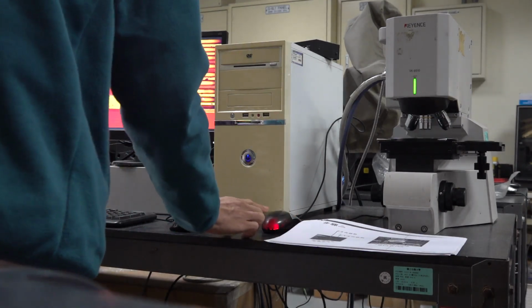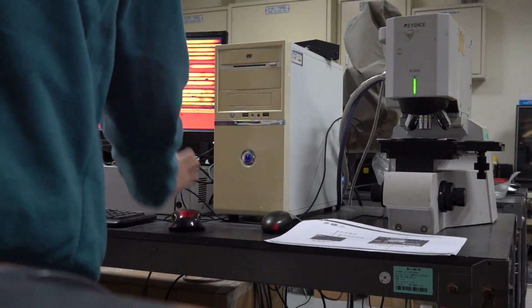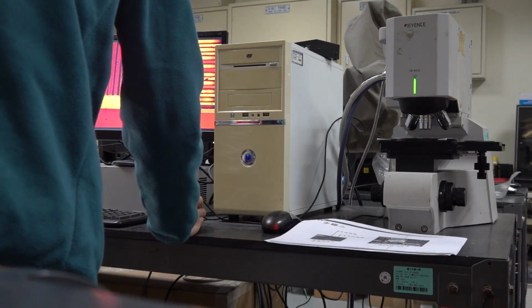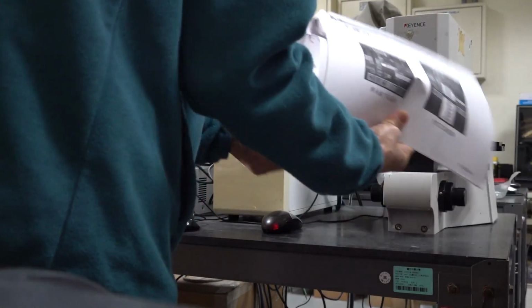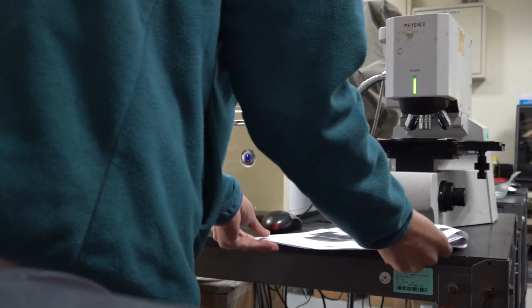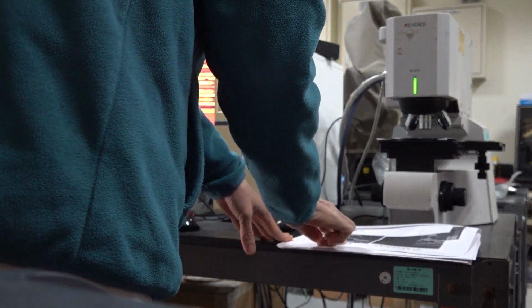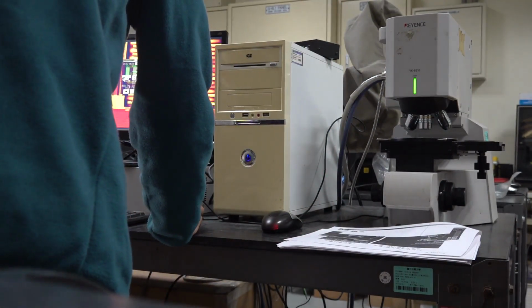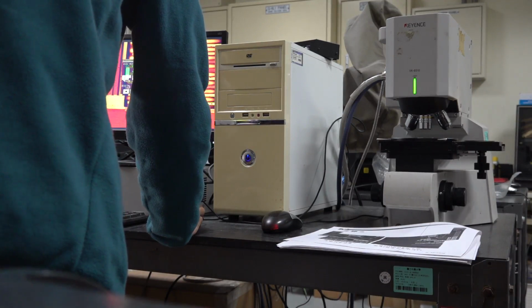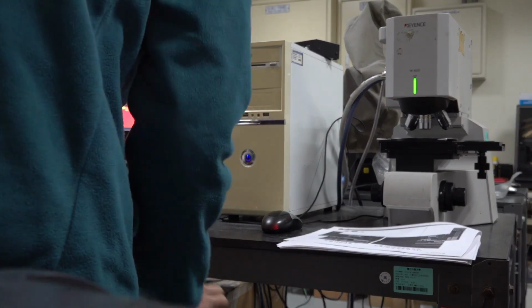So we have 2 mice, one mouse for the PC, the other mouse for the controller. So this one is for the controller. We have several options, so select this one. Step 2. Then step 3, we click on the SHTR button A. So this is SHTR button A. So we click on this one.